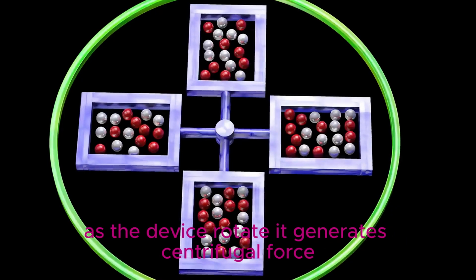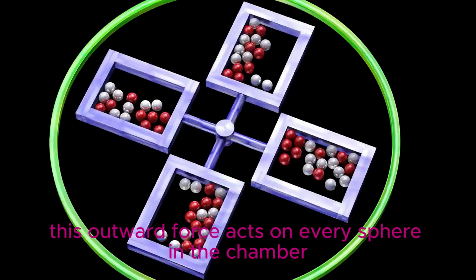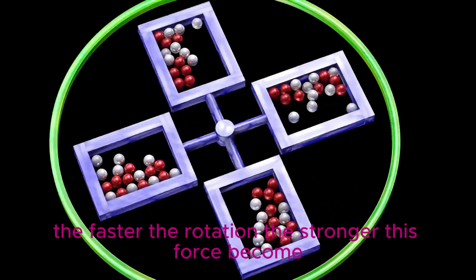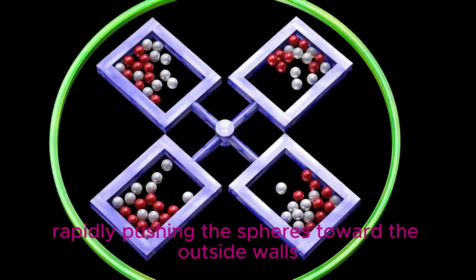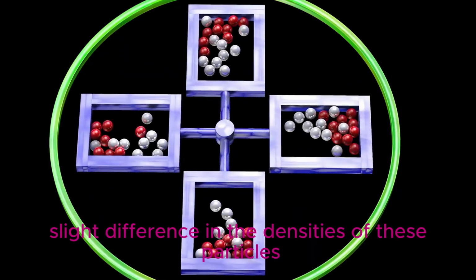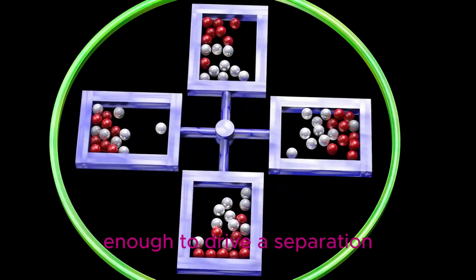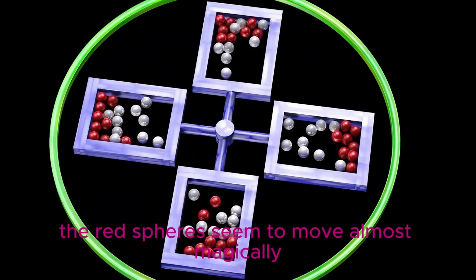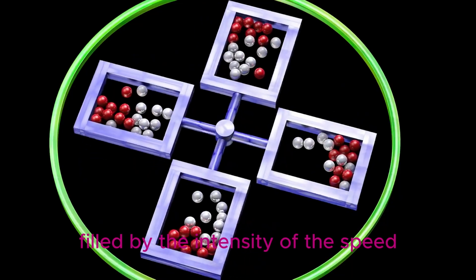As the device rotates, it generates centrifugal force. This outward force acts on every sphere in the chamber. The faster the rotation, the stronger this force becomes, rapidly pushing the spheres toward the outside walls. Even if there is only a very slight difference in the densities of these particles, the centrifugal force is powerful enough to drive a separation. The red spheres seem to move almost magically toward the outer boundary, fueled by the intensity of the spin.